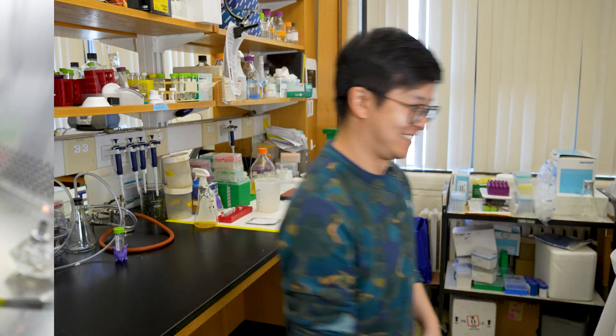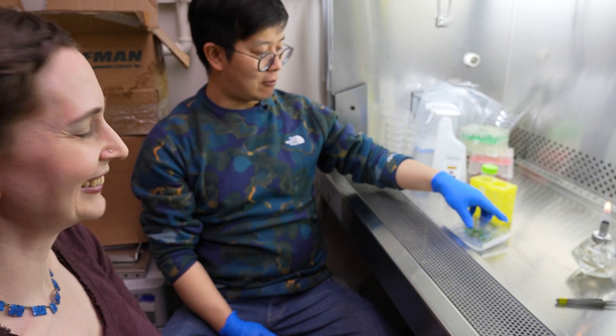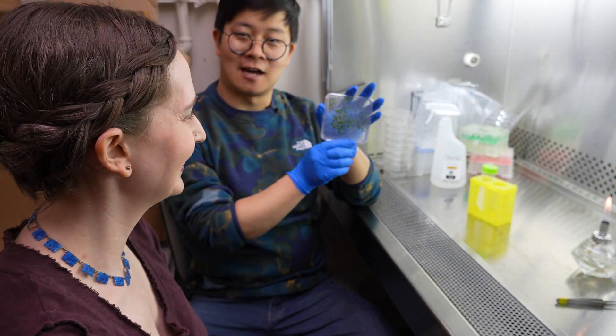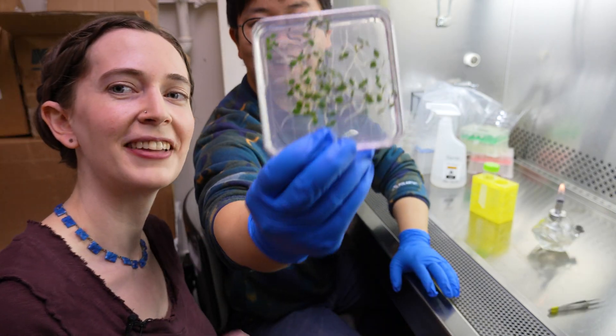But you just figured out how. We are trying very hard to make it happen. You did a really good job. Can we go do the experiment now? Yes, definitely. Let's go. We are ready to roll, and today we're going to use Aquilegia seedlings grown on the media.